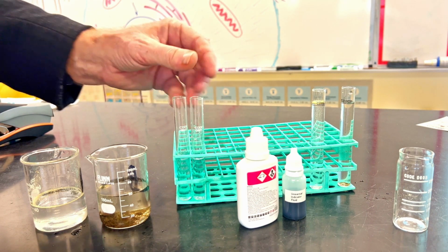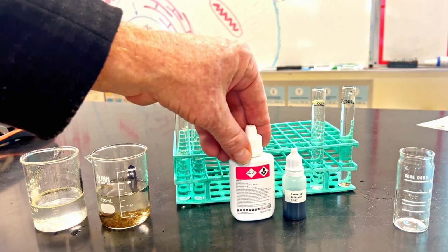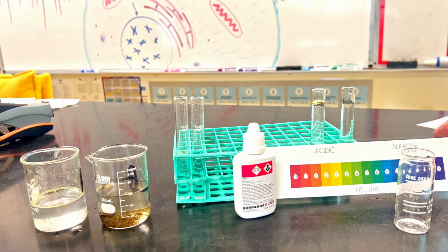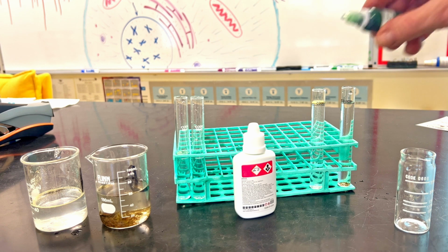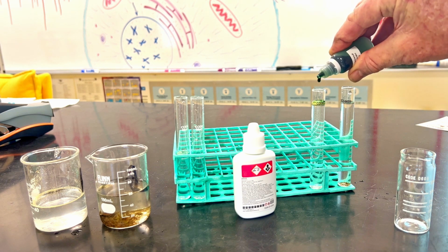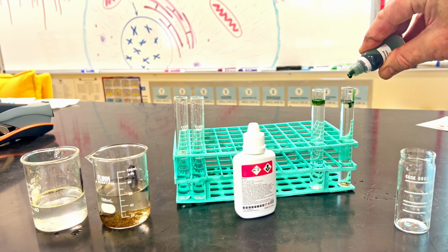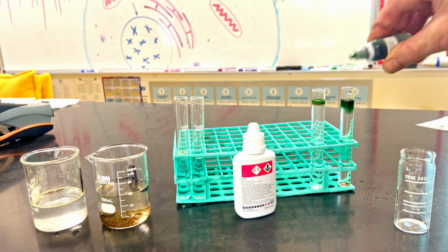So we've got the nitrites prepared, and they're going to sit there for a while. We can go ahead and do our pH. Now we're going to use universal indicator fluid, based off of this chart. So set that down. Now let's go ahead. So once again, 5 drops each. 1, 2, 3, 4, 5. 1, 2, 3, 4, and 5.